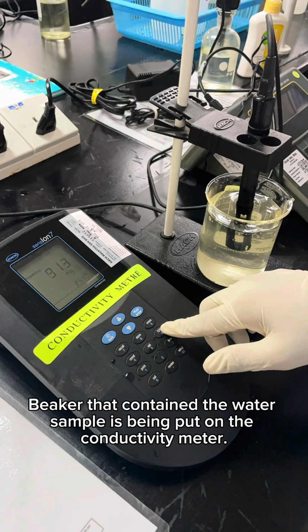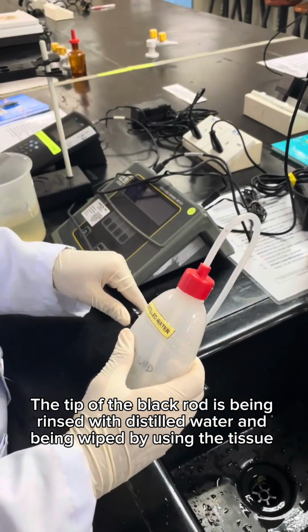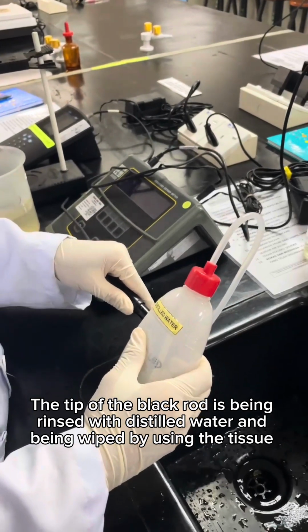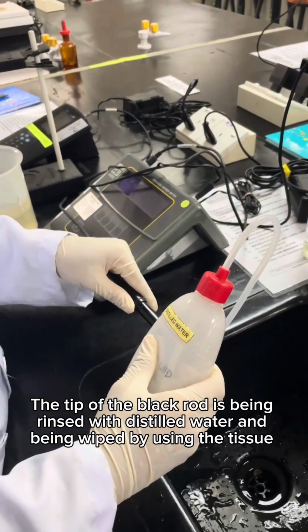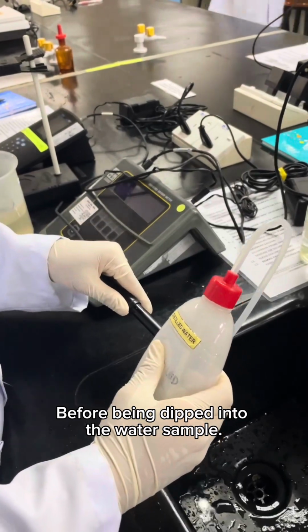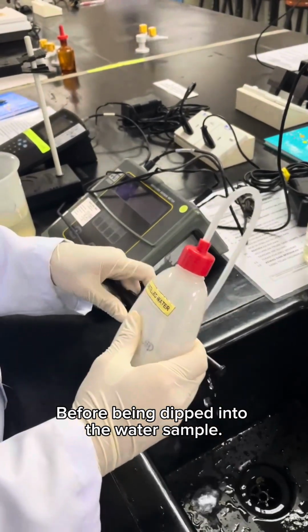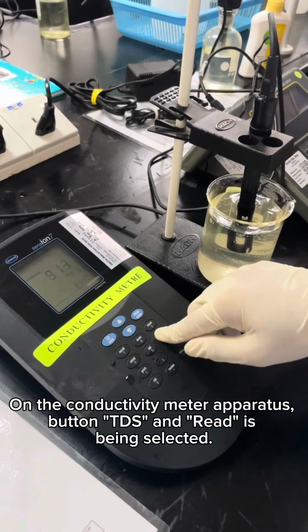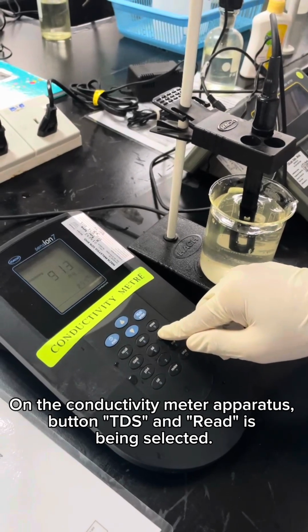The beaker that contains the water sample is put on the conductivity meter. The tip of the black rod is rinsed with distilled water and wiped with a tissue before being dipped into the water sample. On the conductivity meter, the TDS and read buttons are selected.